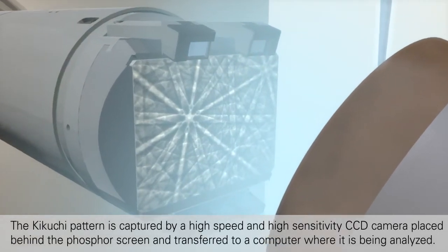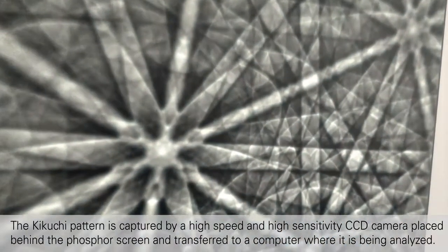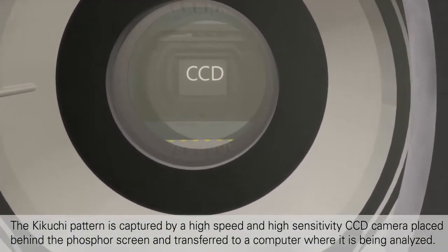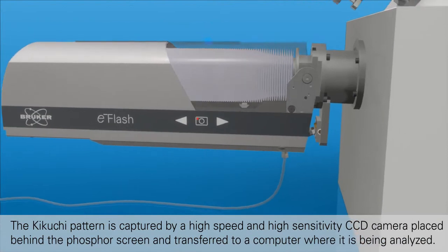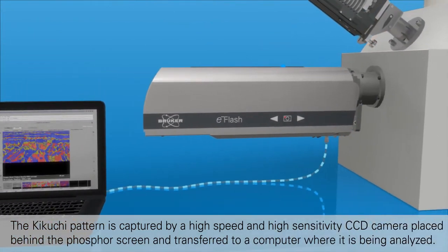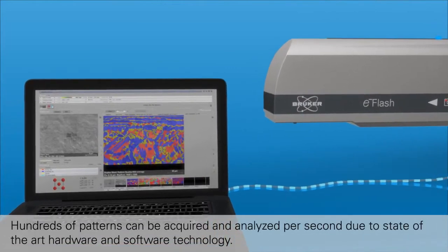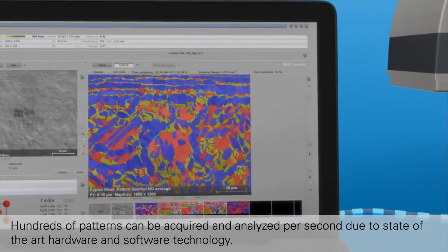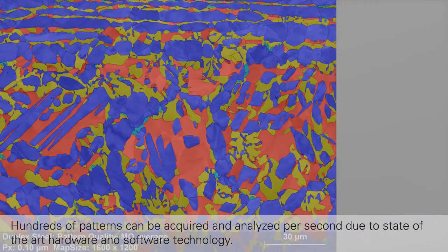The Kikuchi pattern is captured by a high-speed and high-sensitivity CCD camera placed behind the phosphor screen and transferred to a computer where it is being analyzed. Hundreds of patterns can be acquired and analyzed per second due to state-of-the-art hardware and software technology.